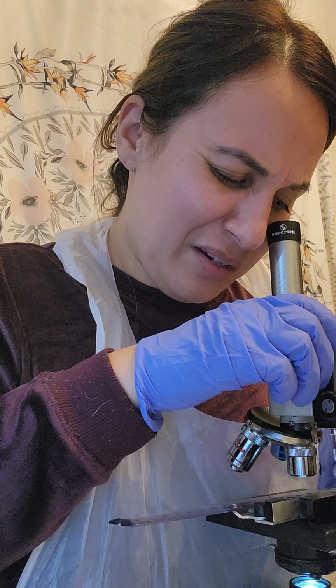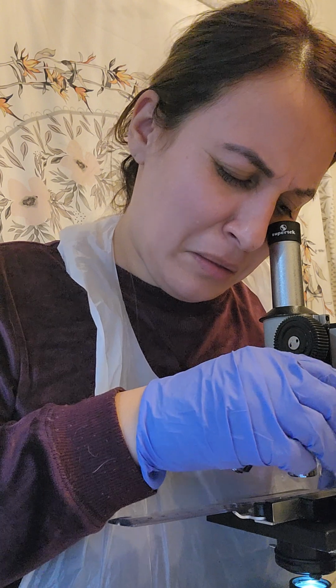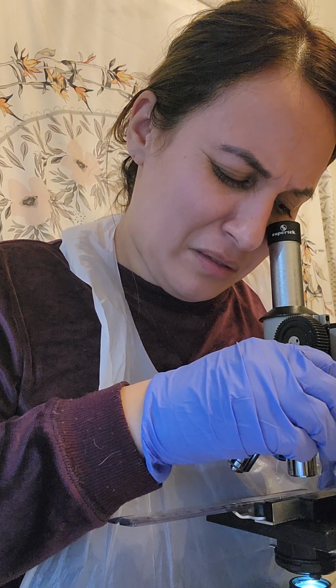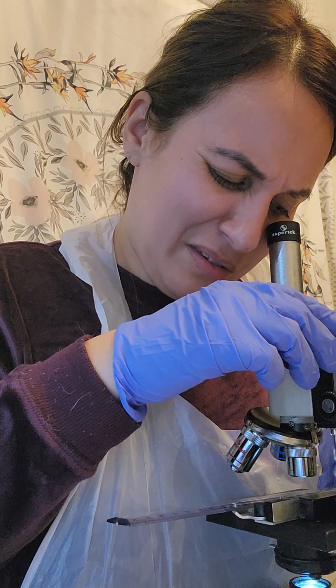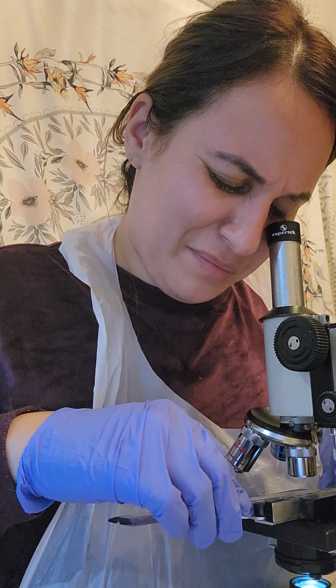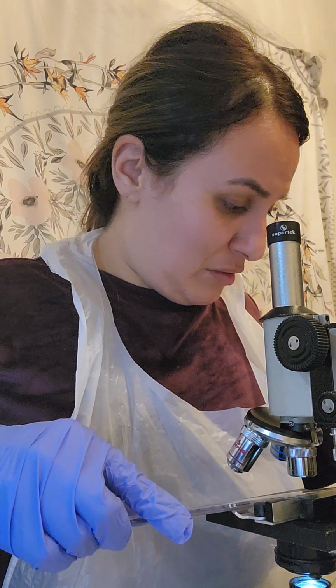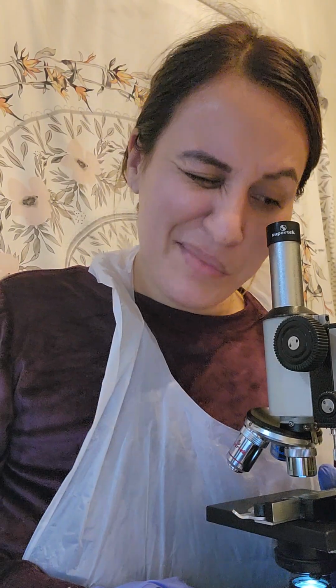So here I am. Looking at this, it wants to use the millimeter part of the ruler. It looked to me to be about 1 millimeter for the field of view on the 4x.